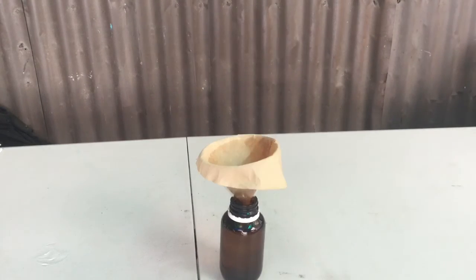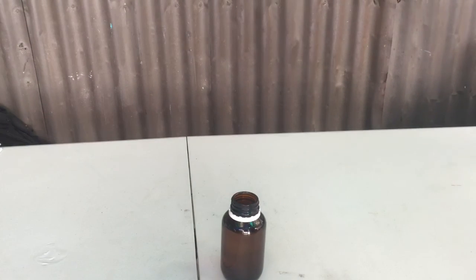It's advisable to check the DCM once in a while to release any of the fumes that may have been produced.